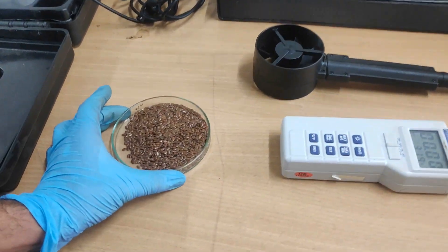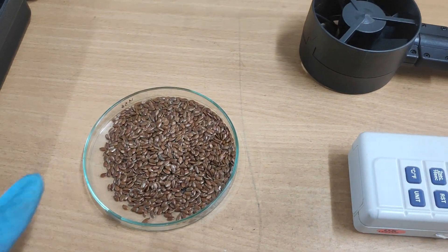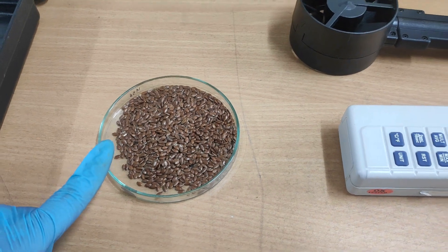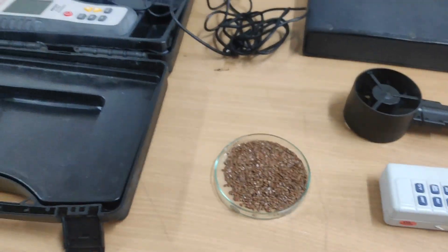Both instruments can be used. The sample for today's experiment is a flaxseed sample. We have already measured 4 grams of flaxseed sample to determine its terminal velocity.